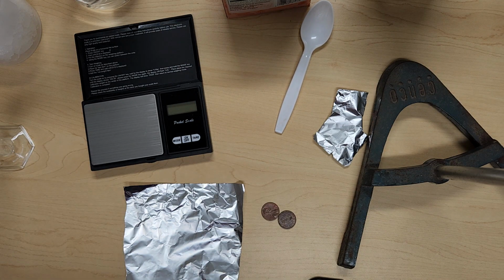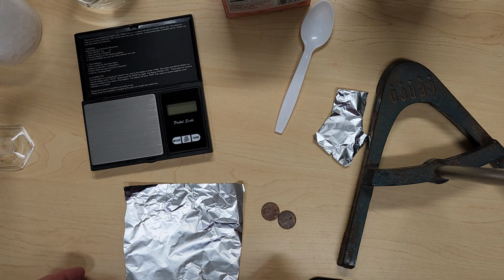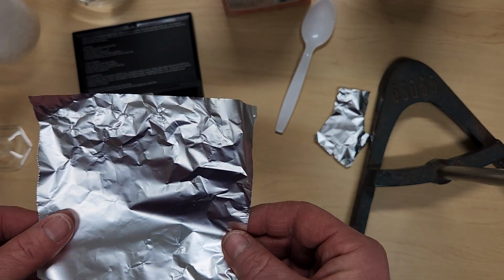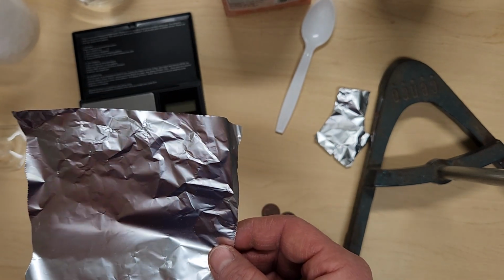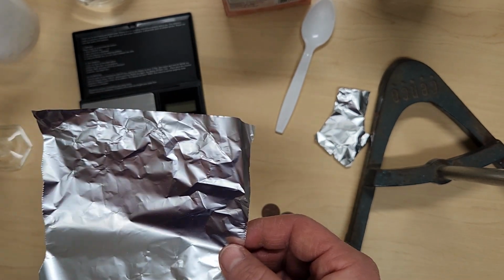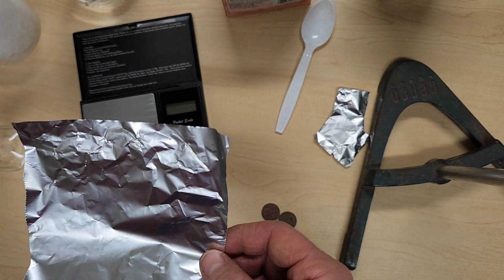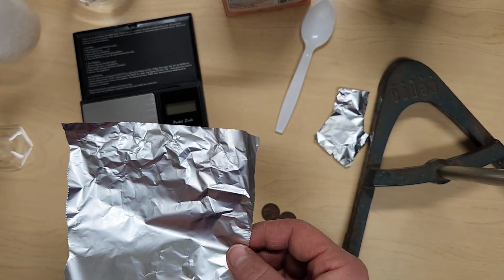Okay. The next thing that is asked to do is ice in an aluminum tray. So if you take a piece of aluminum foil that you have, if you don't have a larger piece of aluminum foil, that's okay. A beaker will work. It'll just take a little bit longer for that ice to make its changes. Okay, aluminum foil helps to speed that up.